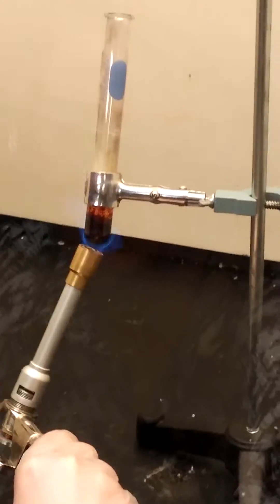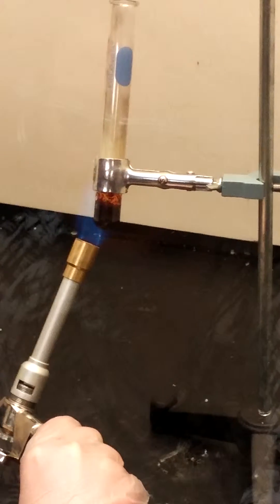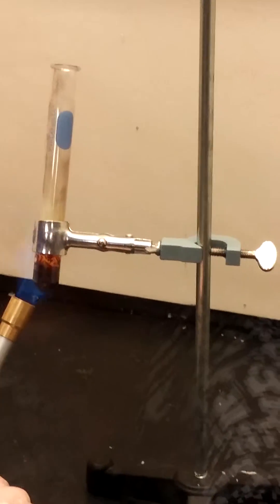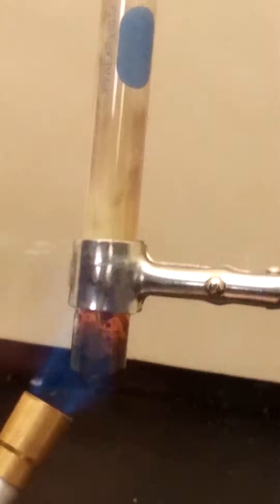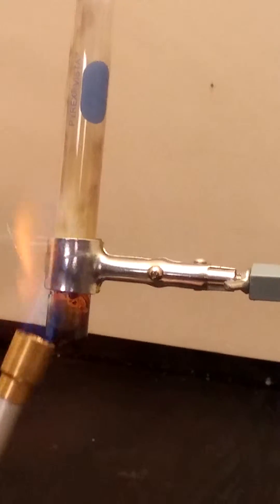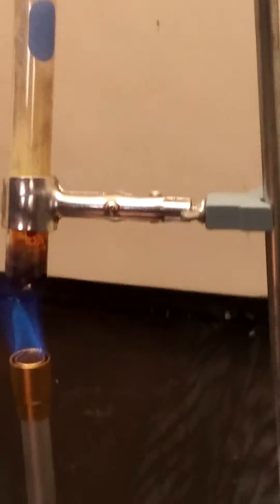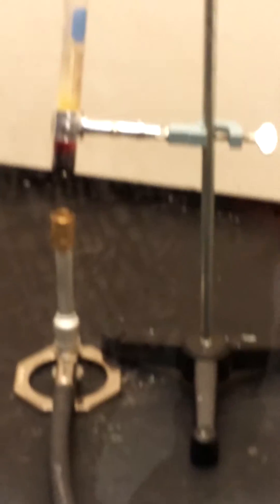I think it's all heated. You can kind of see the fumes going up. I can see it from the very bottom. I can see it bubbling. It's that yellow stuff. What would it take to make these — these test tubes break? It's got to be 3,000 degrees or so. I'm going to shut that off. We're going to, when that cools off, see if it's still magnetic.